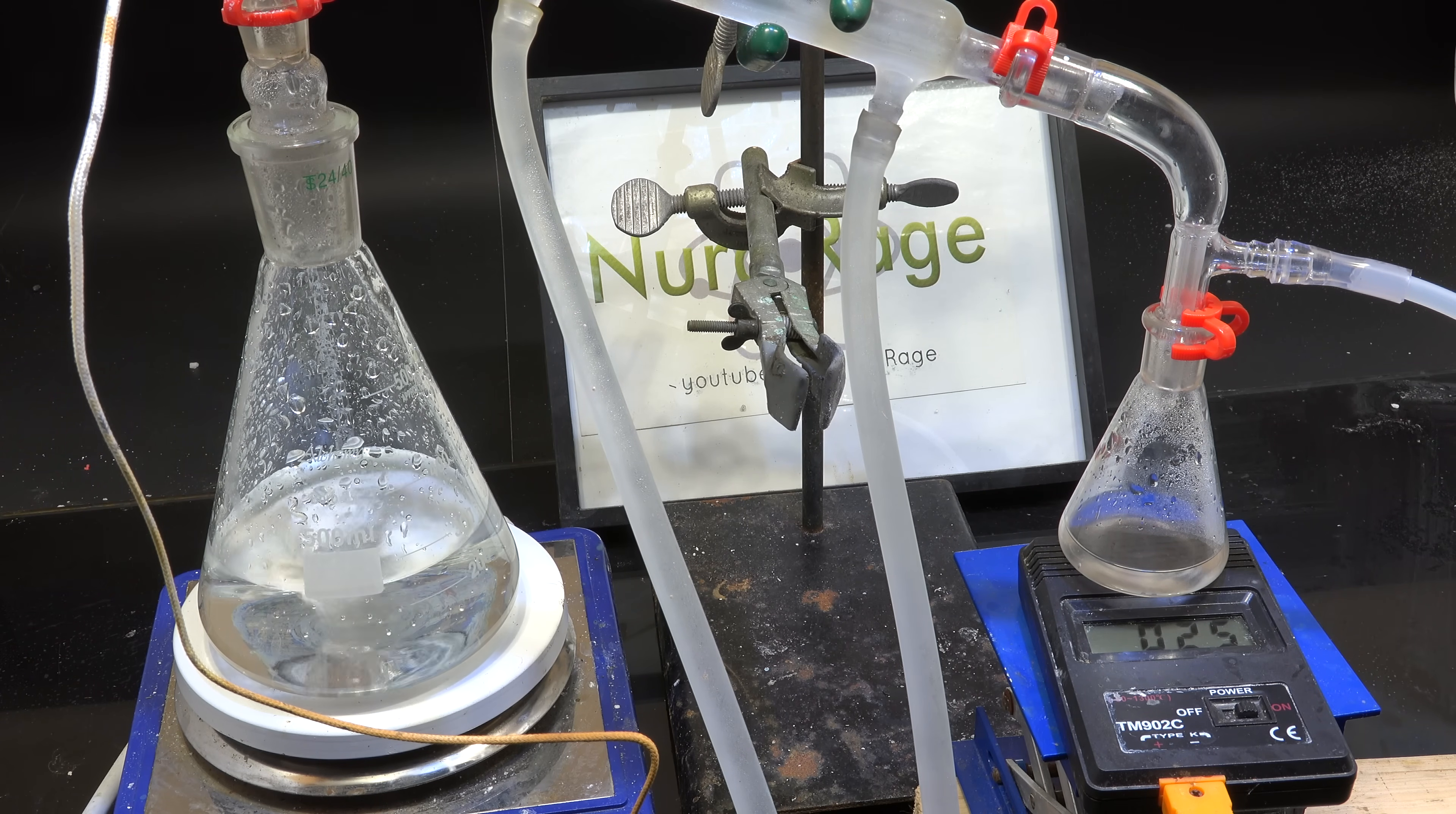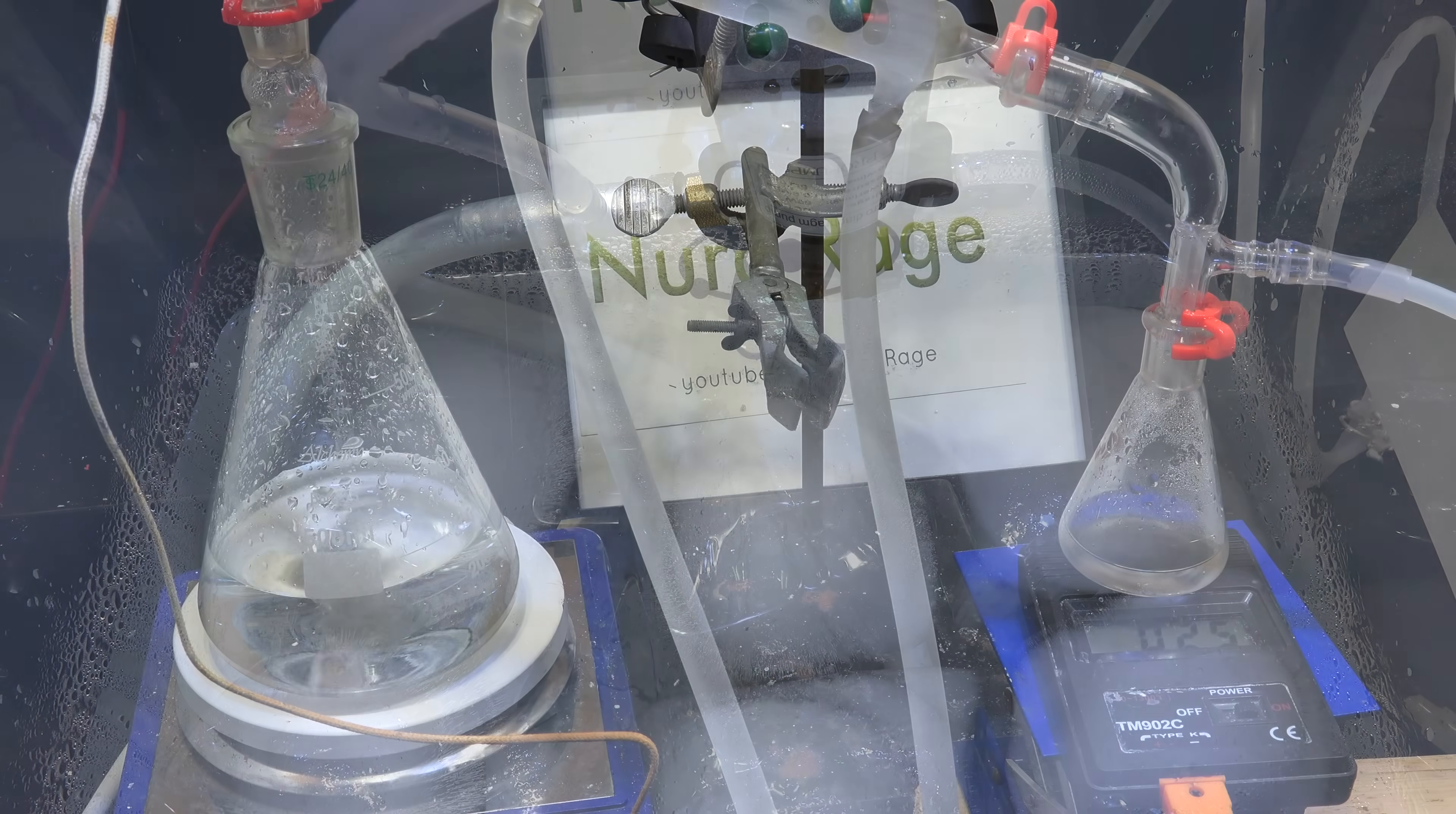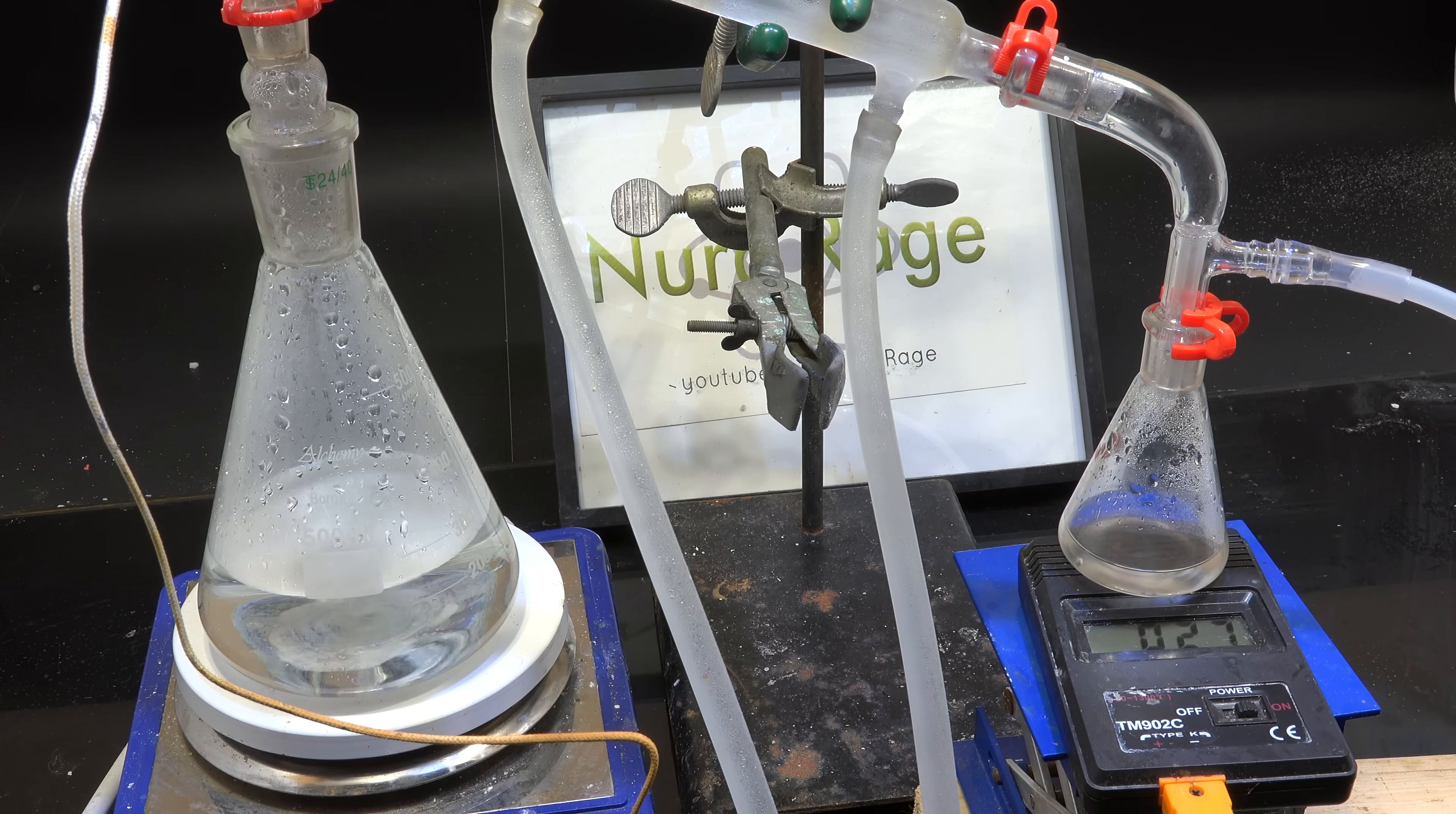Now occasionally the amateur chemist might get the idea of using the aspirator pump reservoir as the condenser coolant reservoir as well. I strongly recommend against this as you'll be pumping whatever contaminated water your aspirator produced through your condenser. Overall I recommend separate water systems for your condenser and your aspirator. Anyway there we go.